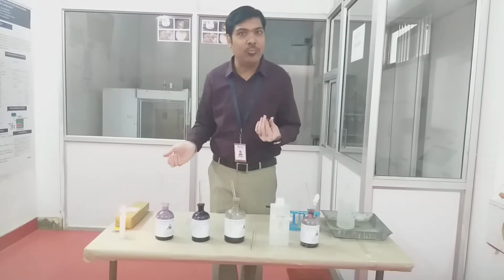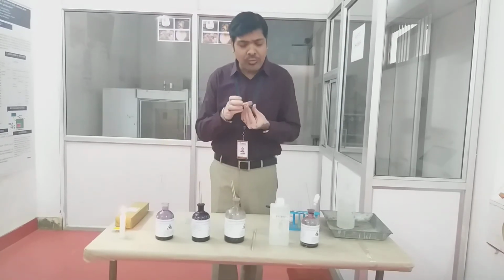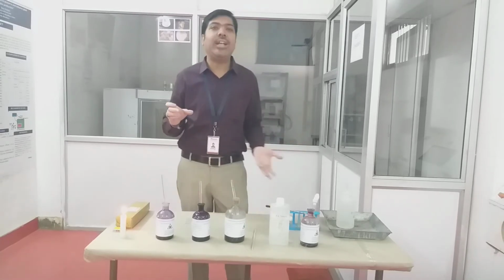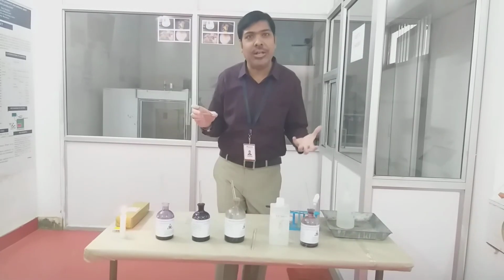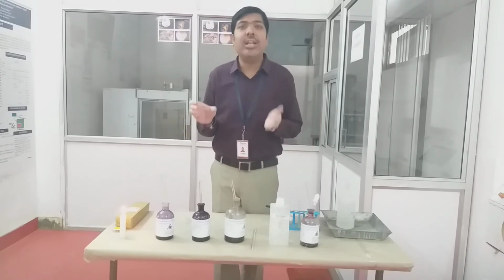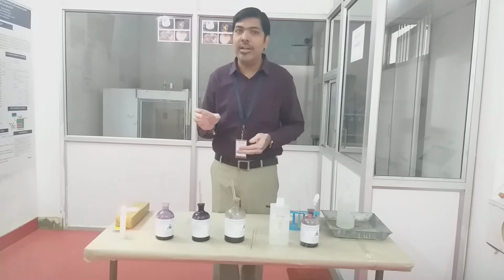color the microbial sample. We know that in case of simple staining we are using different categories of dye. Every dye has a particular exposure time. For example, if you are using methylene blue, then we have to wait for at least 1 minute.